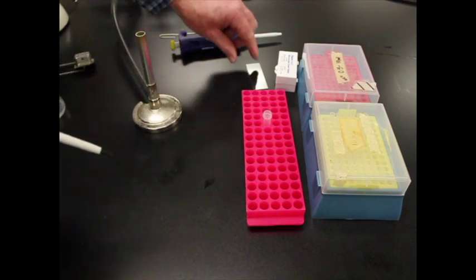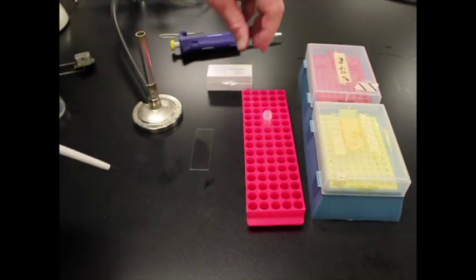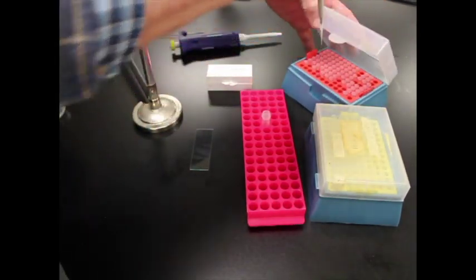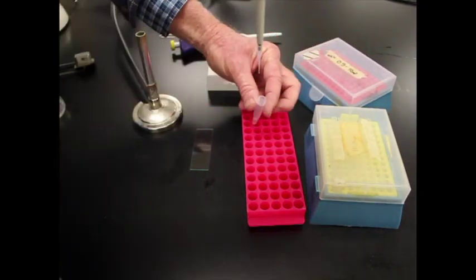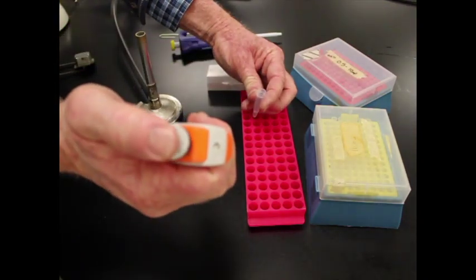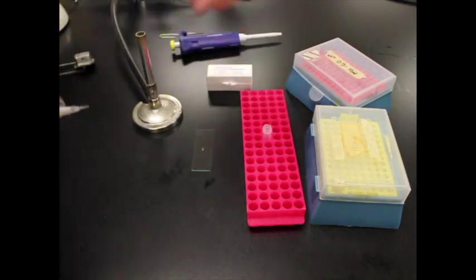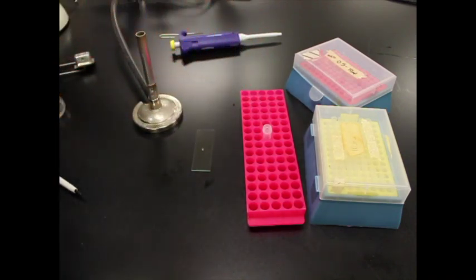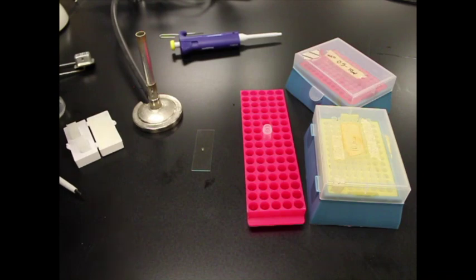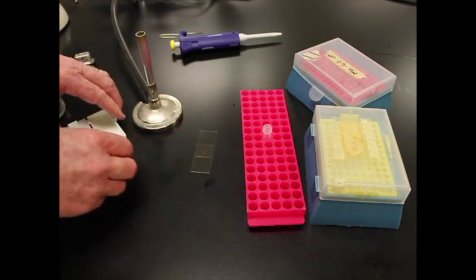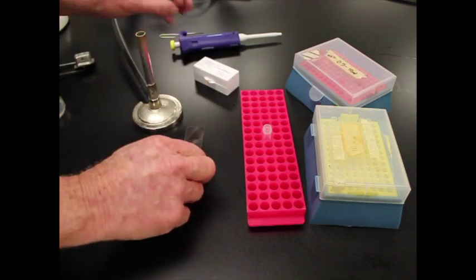Now what I want to do is make a slide. And we'll make a quick wet mount of that slide. So I need a 10 microliter pipette tip. And we'll go in here and get 10 microliters now. Of that, put that 10 microliters on there. We'll get rid of the tip. And then we'll put a cover slip on top. And I always want to kind of be careful getting out cover slips. So I'm going to look at this closely even though it's not on the camera. And make sure I get one nice cover slip, put it on there. And now I'm ready to go view this underneath the microscope.